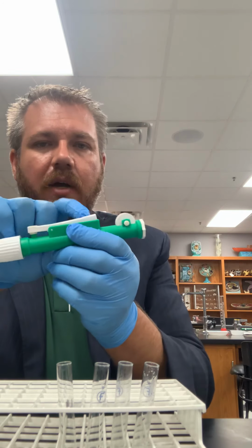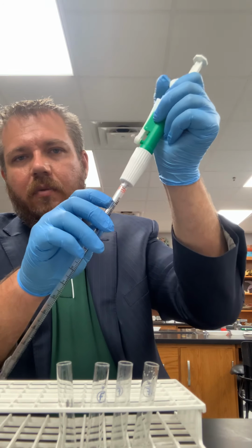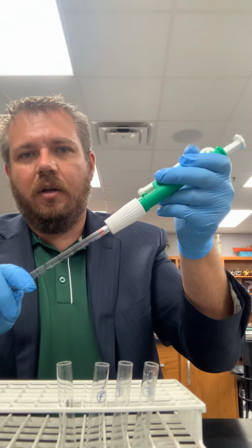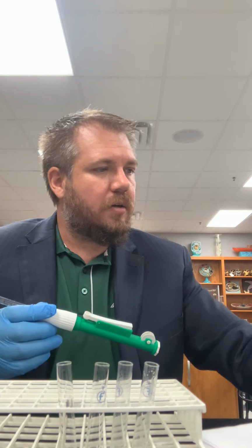So some of them don't have this trigger. The way you operate them is just one way goes up and draws the liquid in, and the other way you roll the wheel the other way or push up here and it'll dispense it down. Same as with the transfer pipette, you don't want to operate things too quickly or it'll splash everywhere. So if you pull it up and then just try to slam that down, you're just going to splash water all over, or whatever your liquid is, all over out of the test tube and such. But so we'll go over here and I'll show you how to use this in a bit more detail. Again, what you're going to do if you're following along with your handout is you're going to have your 4 test tubes.